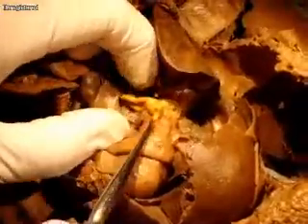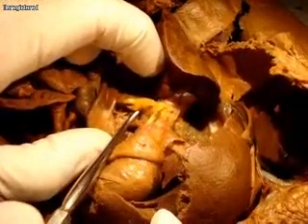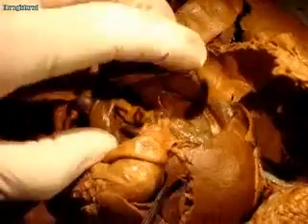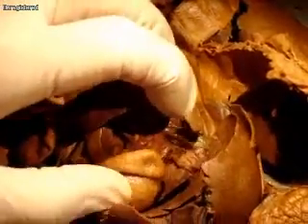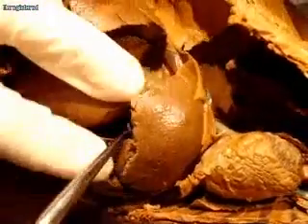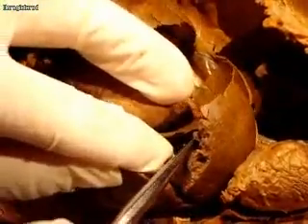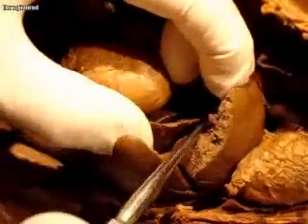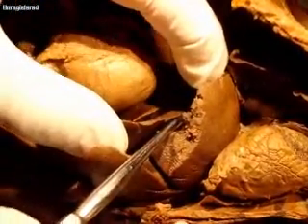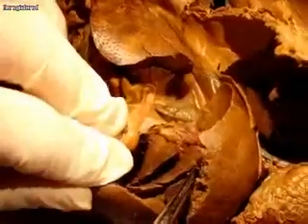Down here is the hepatic portal vein. You can see very clearly a really big hepatic portal vein coming in. Your gallbladder — where's your gallbladder? The gallbladder should be down in here. It's like a little sack. There it is, right there — that's the gallbladder.